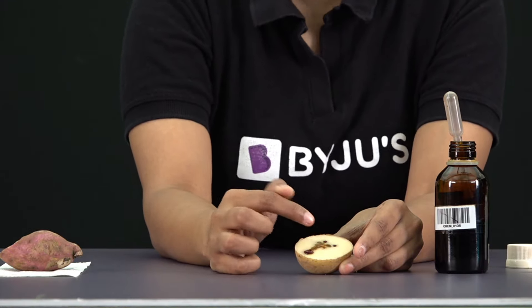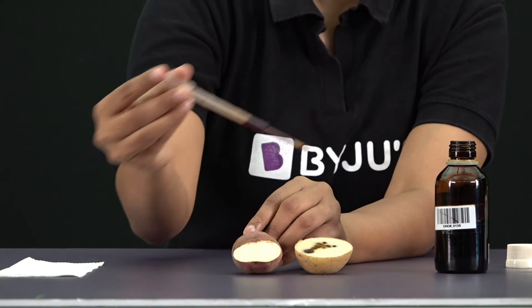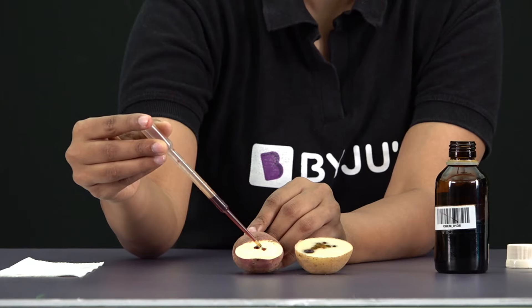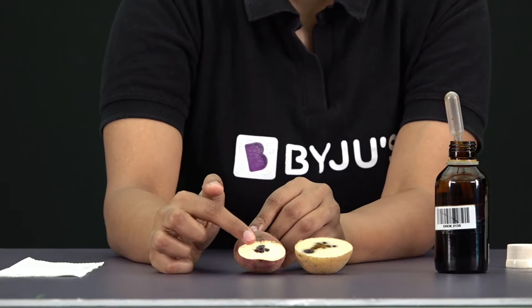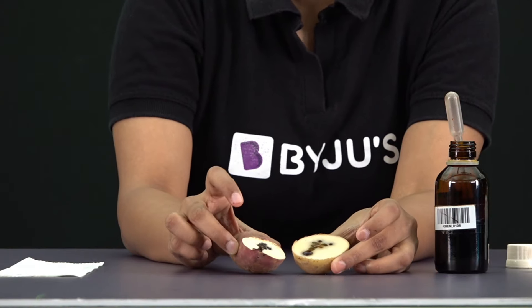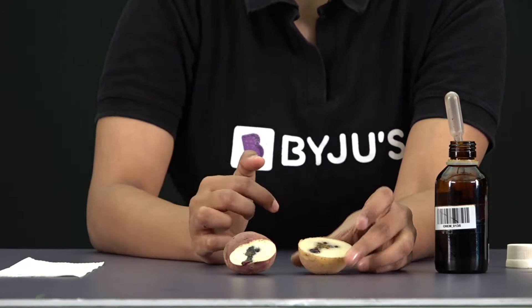This particular change will take some amount of time. But if I take the sweet potato sample and add the same drops to it, almost instantly we will observe a color change. Can you see that? Immediately it has turned blue-black in color, while in the potato sample it is taking a while — but nonetheless, we are able to observe the blue-black color. This goes on to show that this blue-black color detects the presence of starch, and we can do this with the help of the iodine solution.